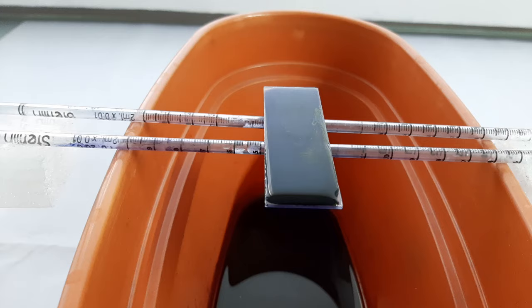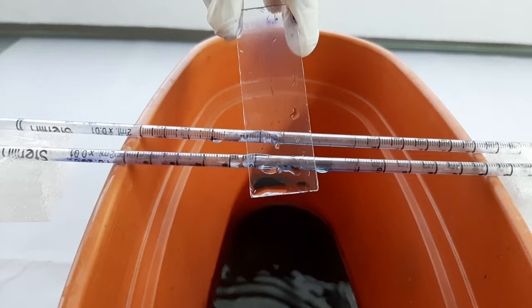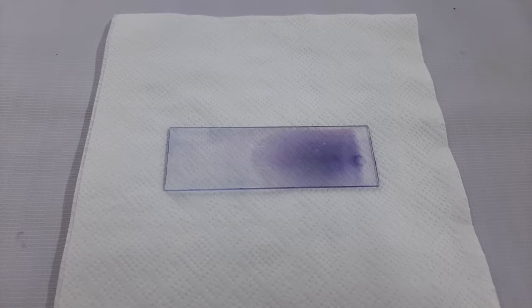After the incubation is over, take the slide to drain off the excess stain and wash the slide with distilled water. Place the slide on a tissue paper and allow the slide to air dry.